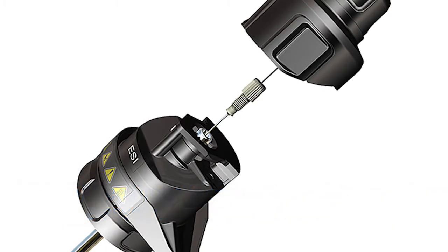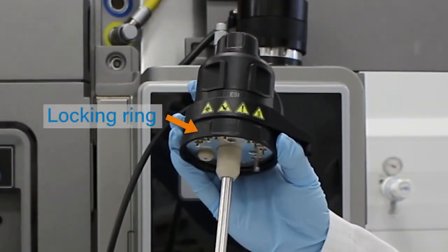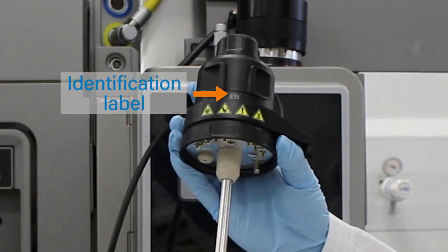The probe adapter includes the cap, the cap tether, locking ring, identification label, and the release buttons.